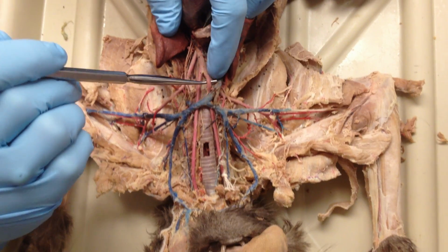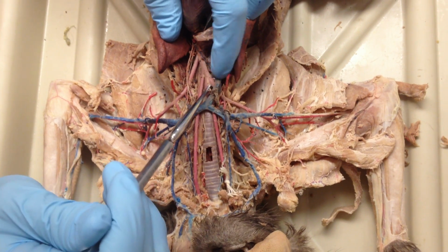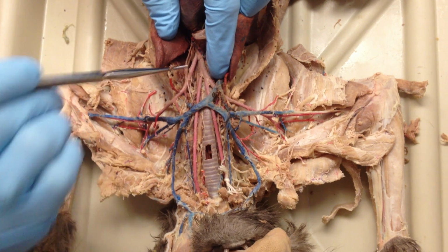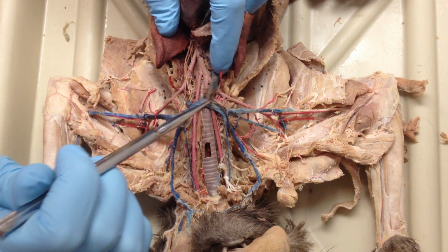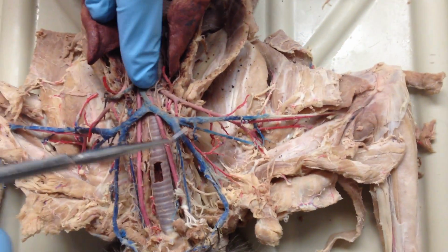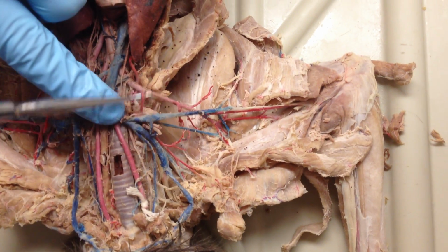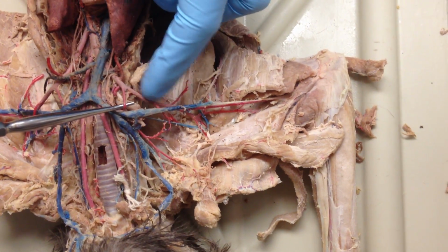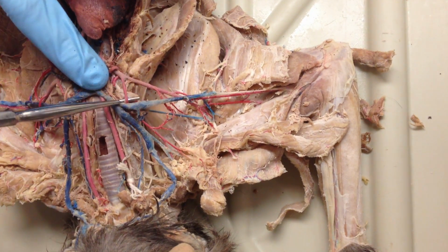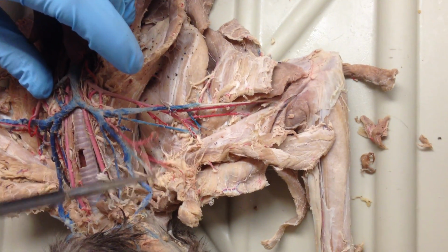The second branch here is your right common carotid, and then you have your right subclavian over here, which looks different from your left subclavian over here. So right subclavian, you're looking for your first branch off of that going forward, and once you've found that, that stops being subclavian and becomes axillary down the length of the artery. So this one is thyrocervical, which then branches down here after thyrocervical, then transverse scapular.